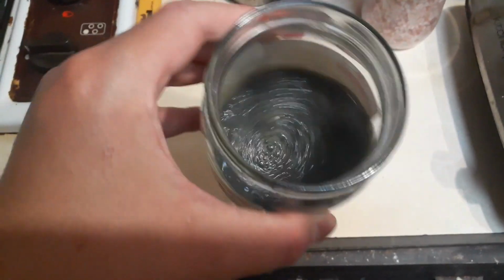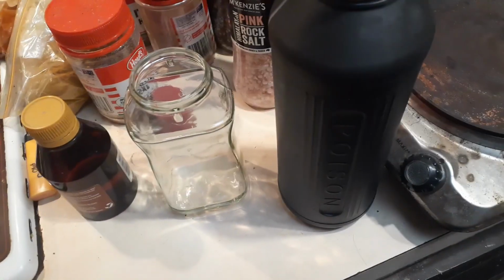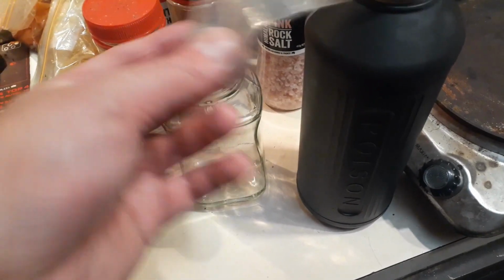While this can dissolve metals into their salt form, I find when alkalizing it, it produces a very wrong effect, as you can see there. Anyway, let's get into it. So I'm just going to put the metal in and put half and half of the acids.